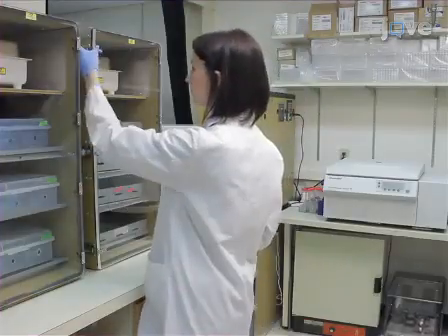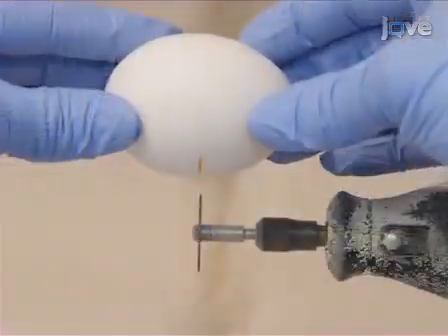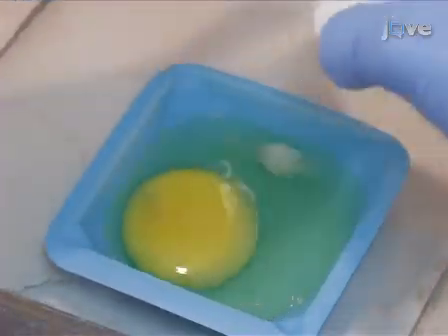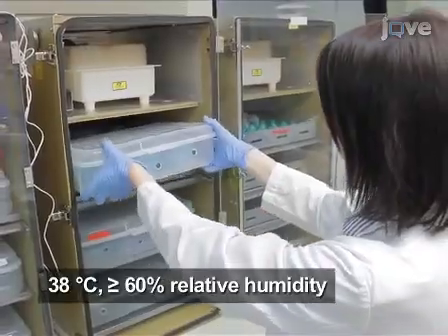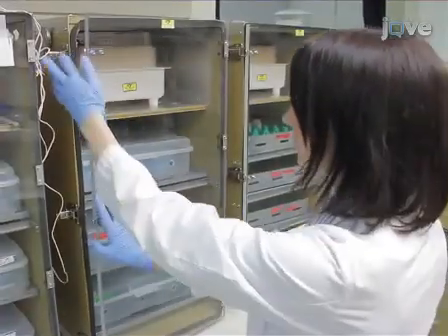For this protocol, prepare shellless fertilized chicken embryos at day 4 using the standard method. Ensure that the embryos are fertilized and viable by checking for a heartbeat, and incubate them at 38 degrees Celsius with at least 60% relative humidity until embryonic day 9. The embryos are then ready for tumor cell inoculation.